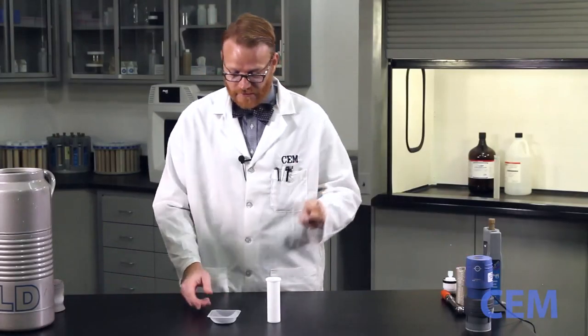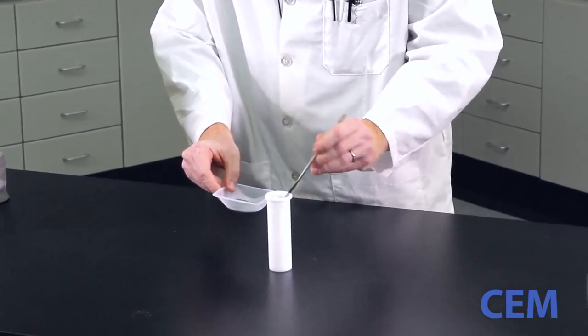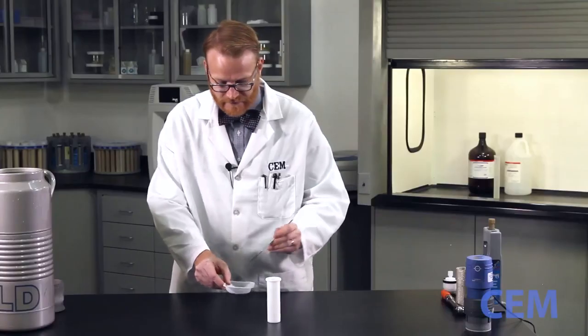So I have a spatula here. Take a little bit. Approximately half a gram. That looks about right.